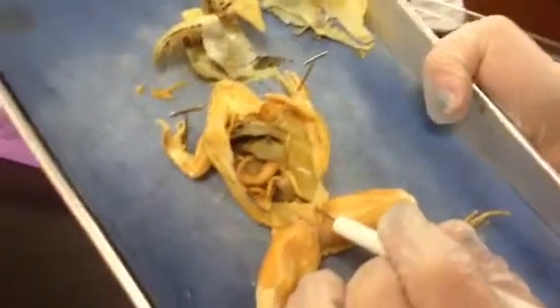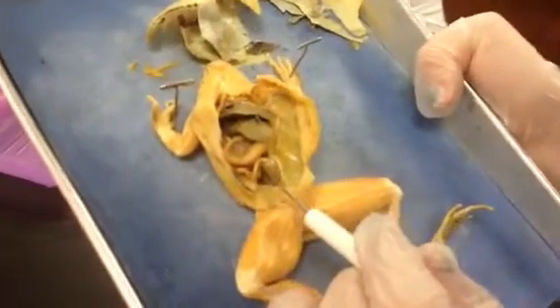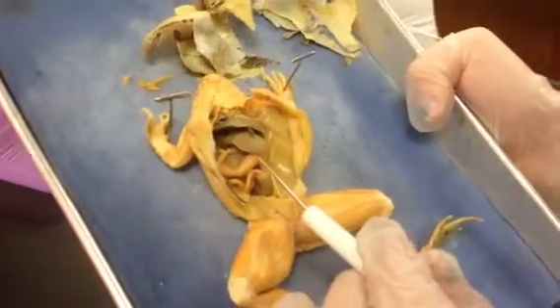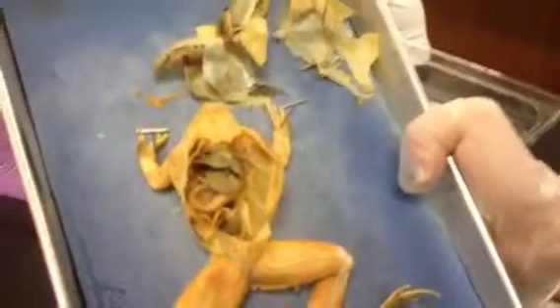This is the spleen, and then this is the testis. So the spleen has to be nice to the testis. And this is Dexter.